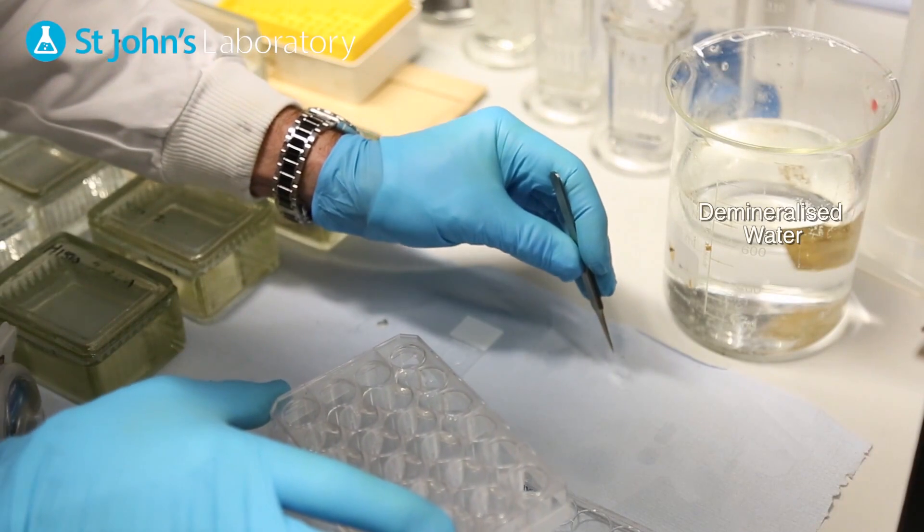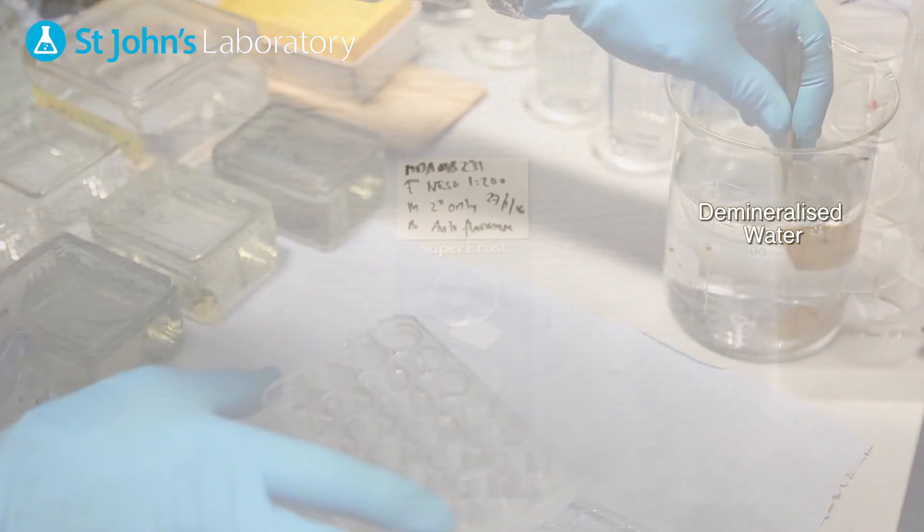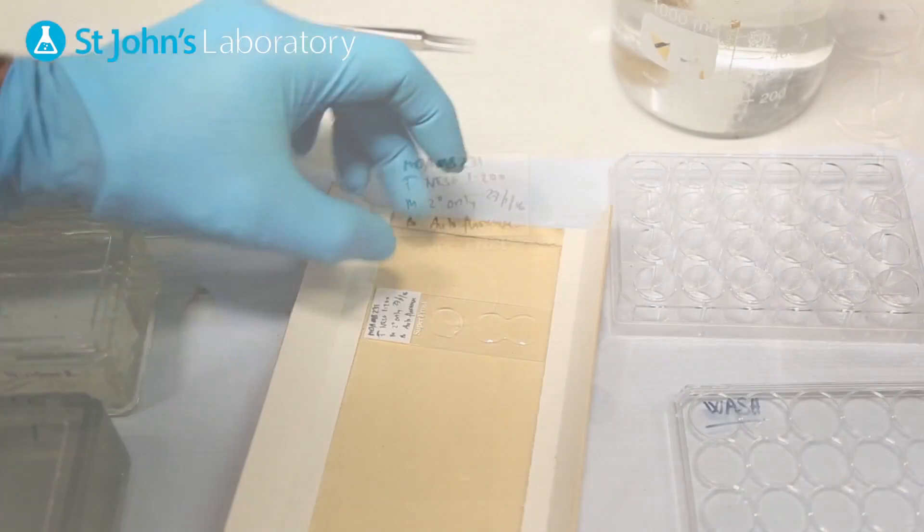Finally to complete the process rinse your slides in demineralized water ready for mounting and visualizing under the microscope.